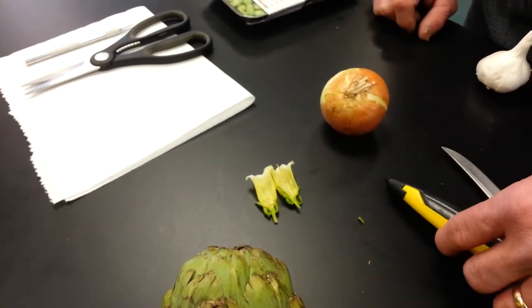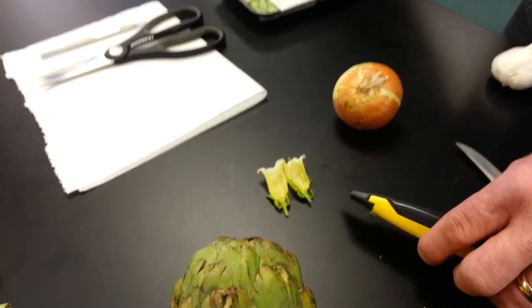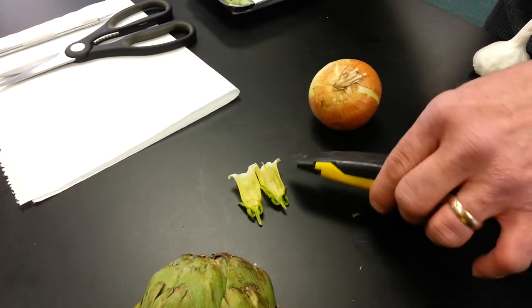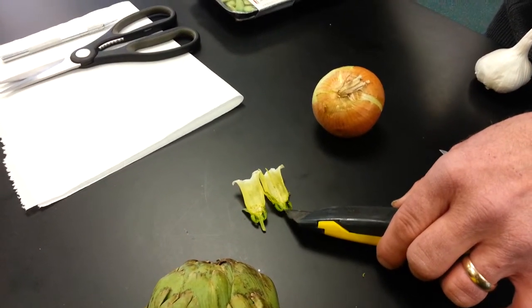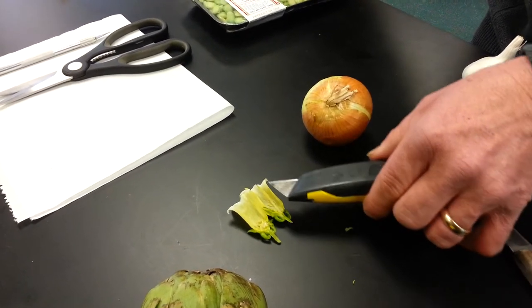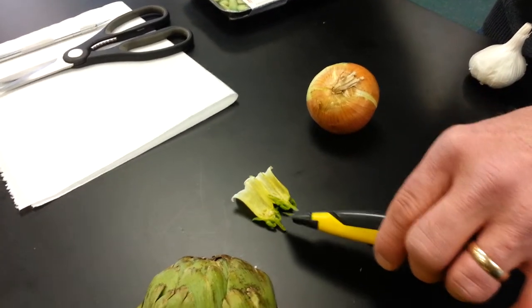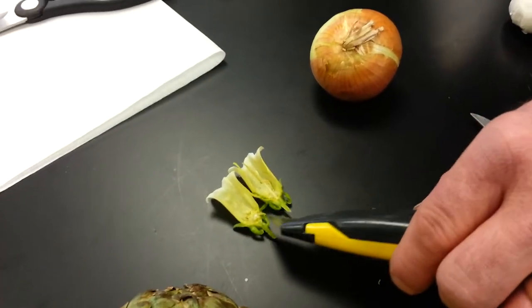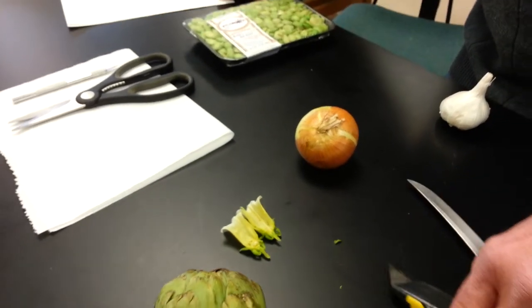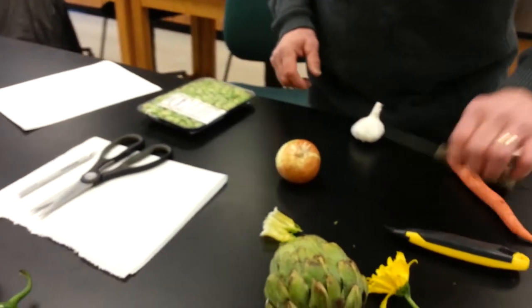What I'd like you to do is on a plain sheet of paper, eight and a half by eleven, draw this view of what you see and label the structures that are visible. Many of the structures are in the base of the flower, but you can also see the female parts of the flower, and there are some male parts — the stamens. Using the information in the text, I'd like you to draw a flower if that's one of the categories you choose.